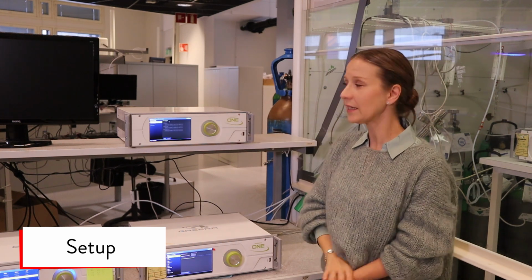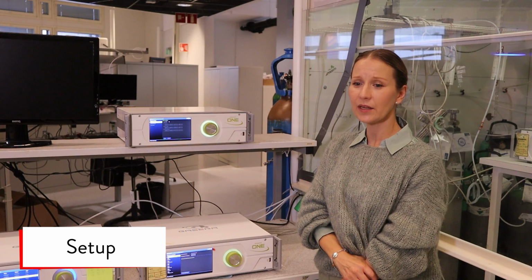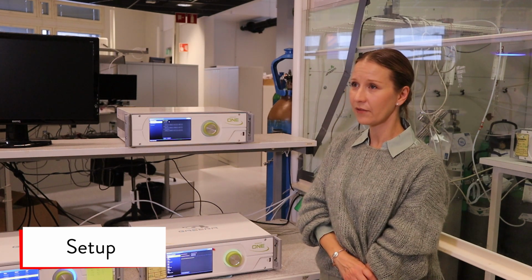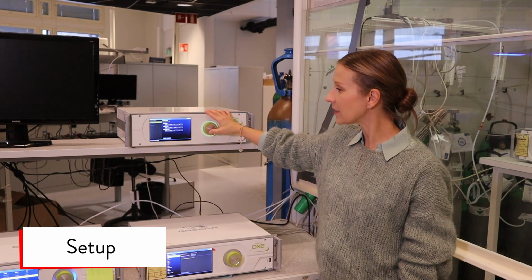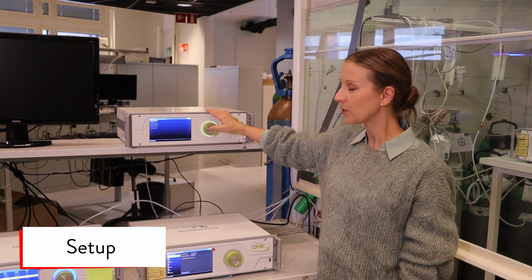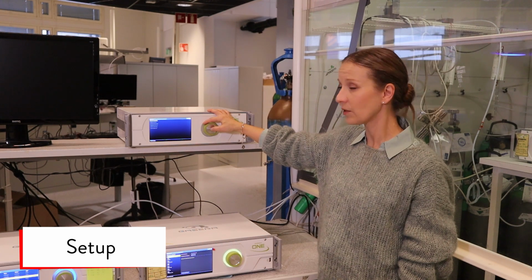In the network settings, there's DHCP, which means that the device will look for the first available IP address. If you unselect this, then the IP address for the device is constant. Under the remote control, there are options for external connections.